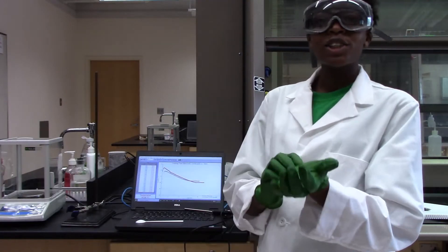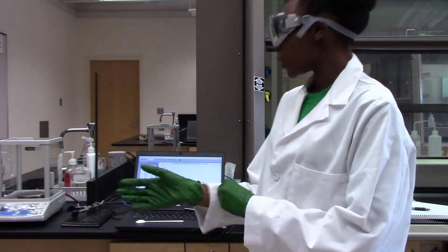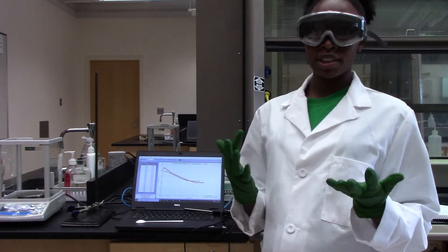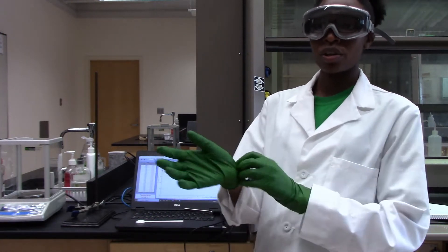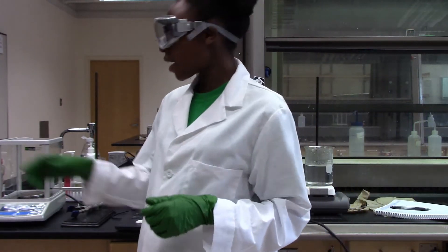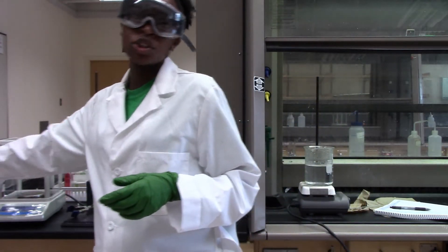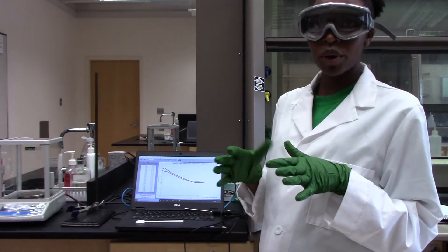Hey guys, so today we are doing an experiment that involves freezing point depression. We know that something freezes at a constant temperature or it boils at a constant temperature.